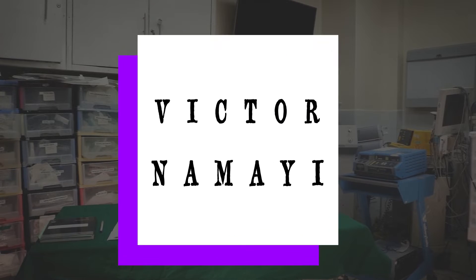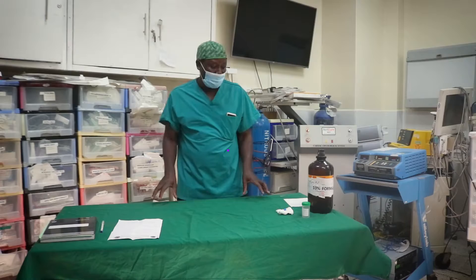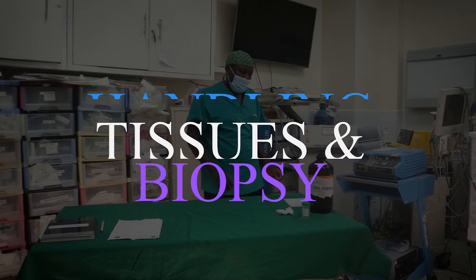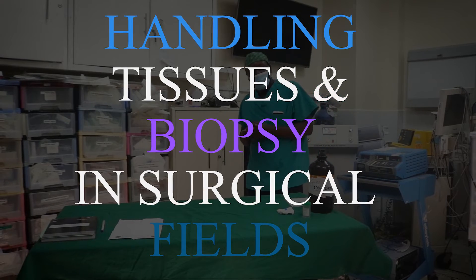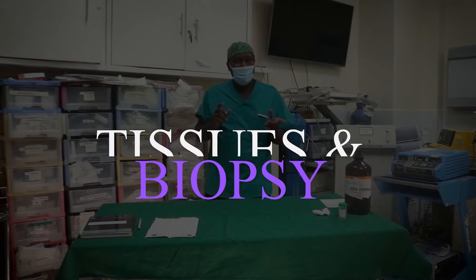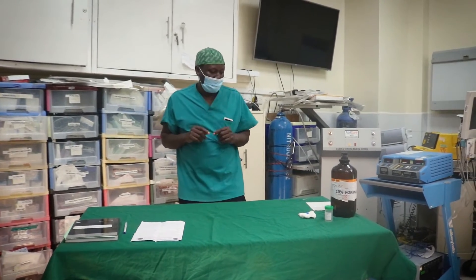Today we are going to learn how to handle tissues and biopsies in a surgical suite. To handle tissues and biopsies in a surgical suite, the first thing we need to do when a tissue has been removed from a patient is collect the tissue.